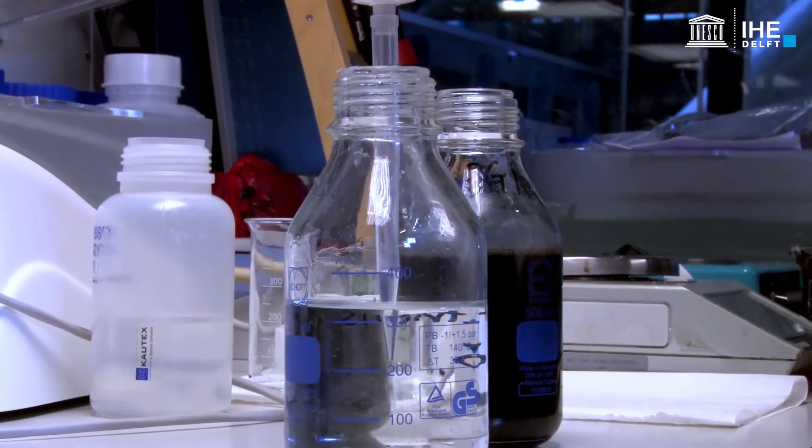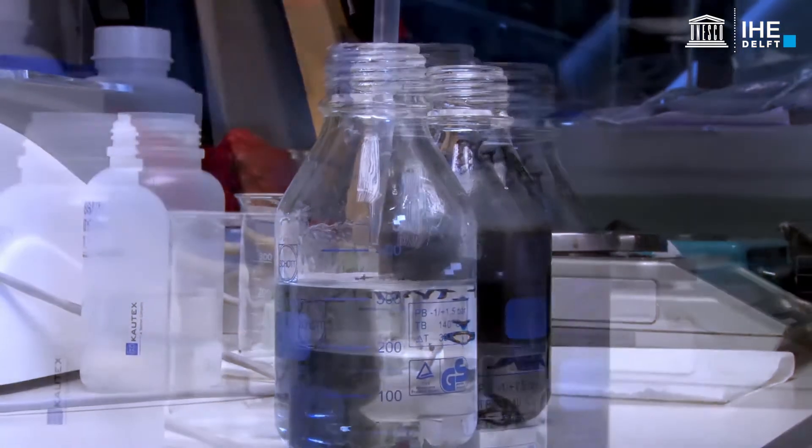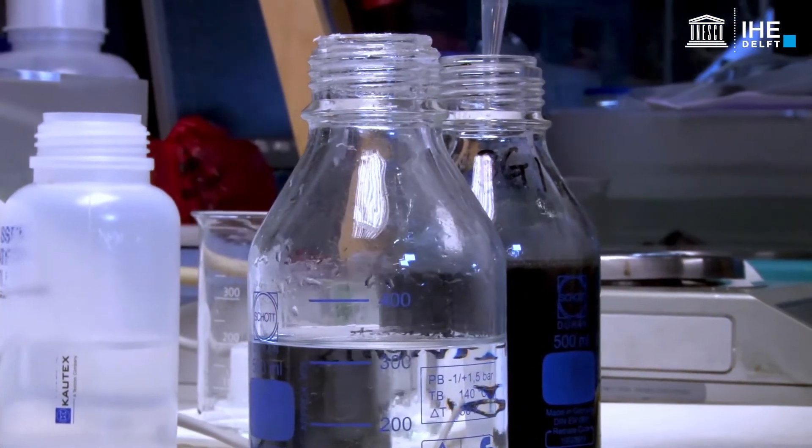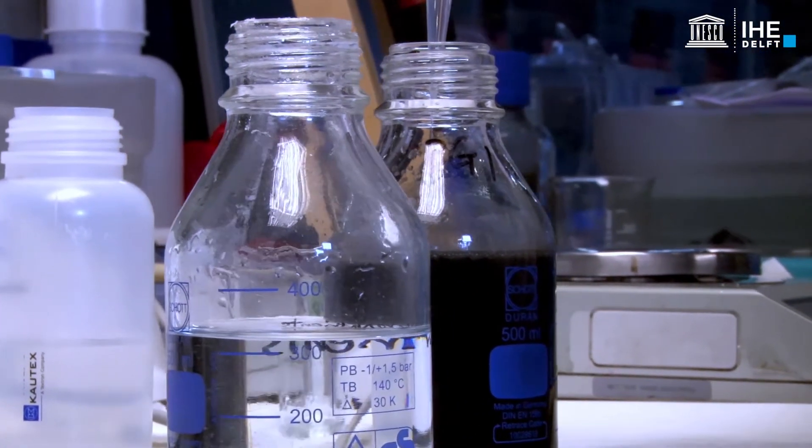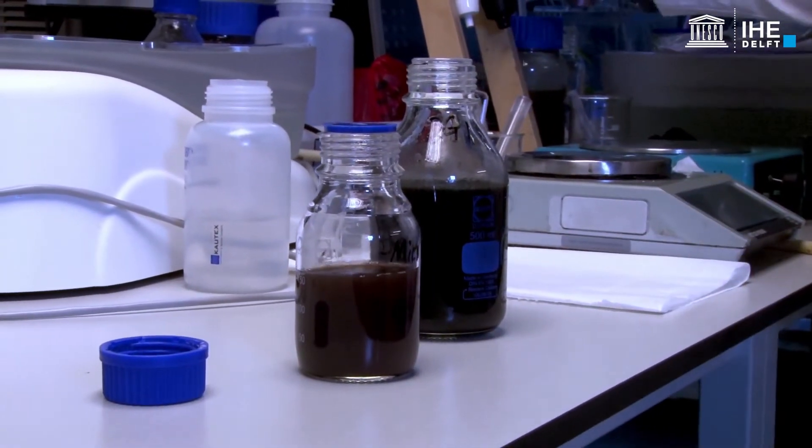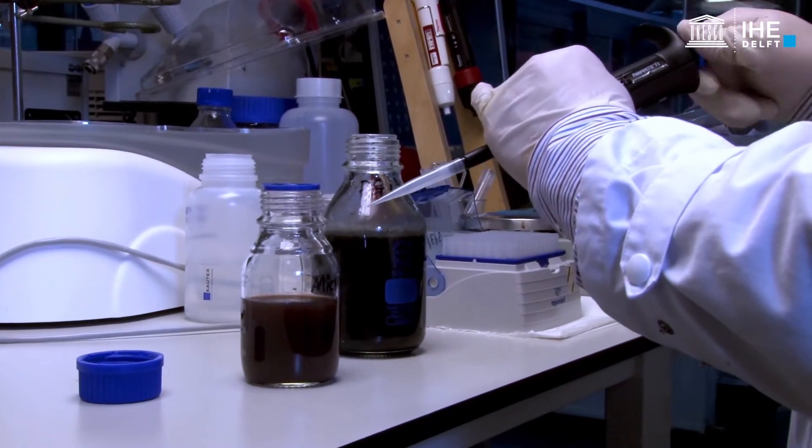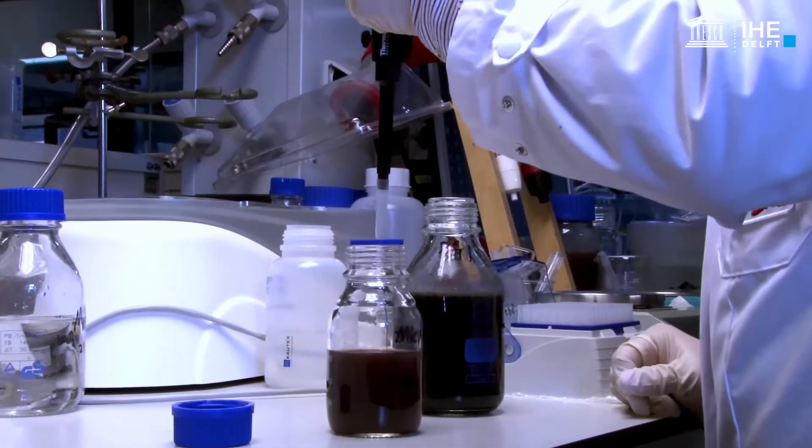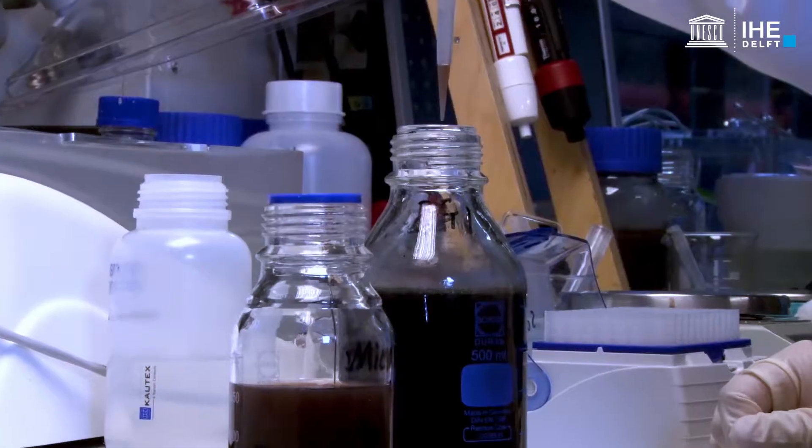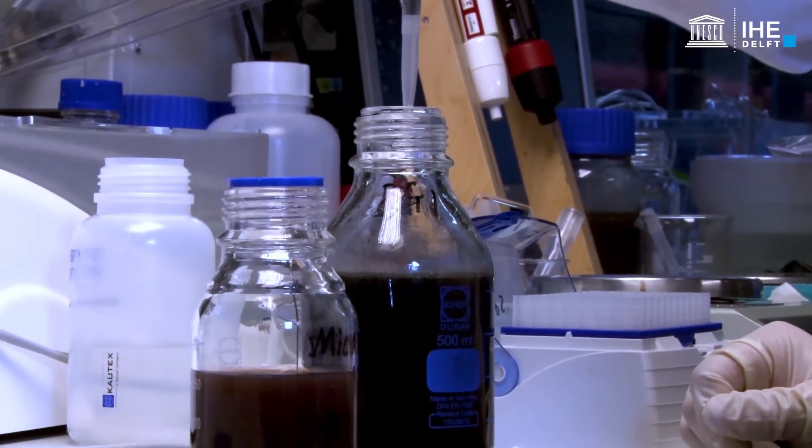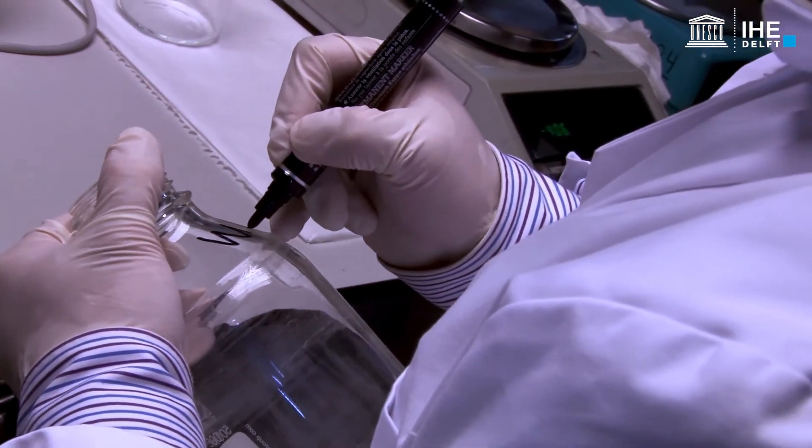Then add the macronutrient solution. Mark the bottle.